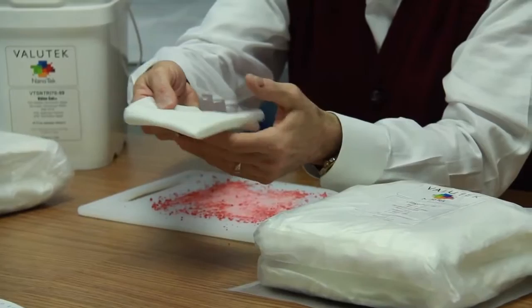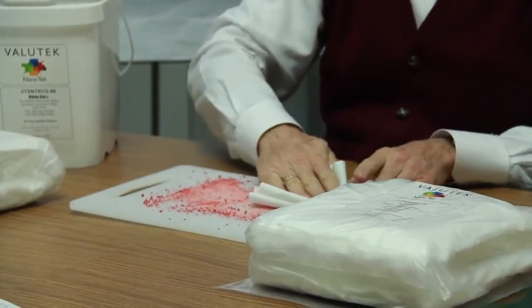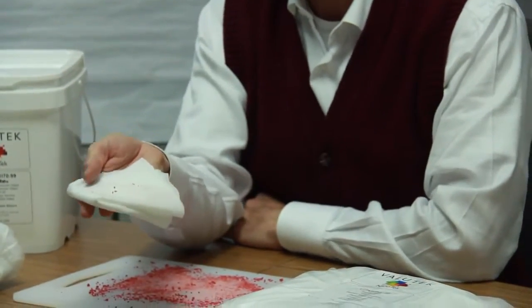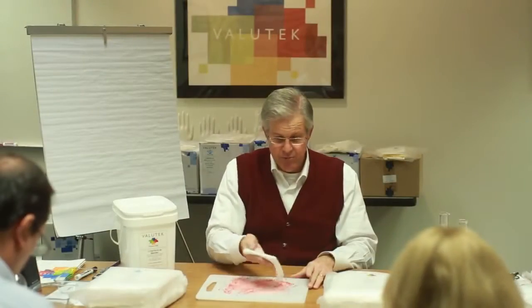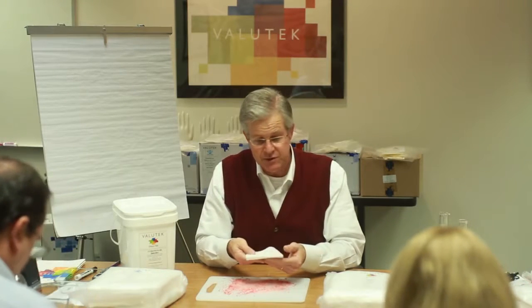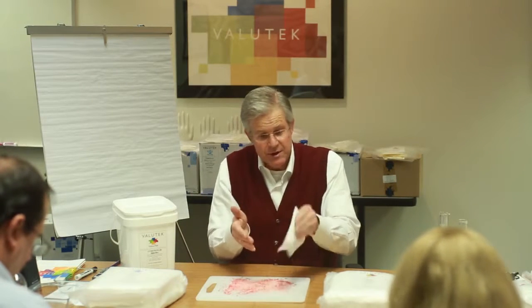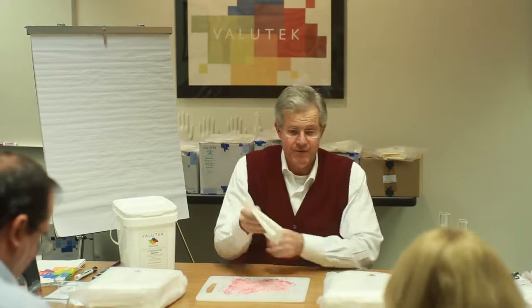And what I'm going to illustrate is what happens when you take a dry wiper and you go to wipe a surface clean. What you see is that very few of the particles cling to the wiper. Really what I've done is just moved around the particles. I've dispersed the particles because a dry wipe doesn't have any coefficient of friction. There's just a little texture on this wipe that causes some of the particles to be trapped, but the particles aren't going to cling to the wipe. And as you can see, as I shake the wiper, all the particles are going to come off.